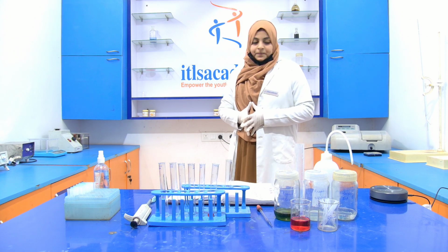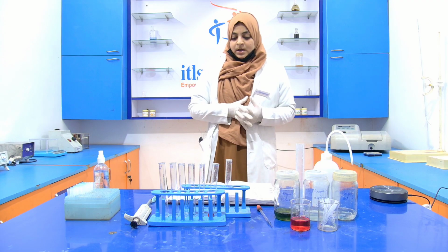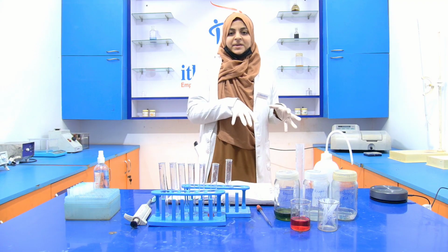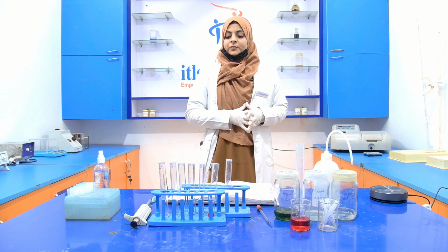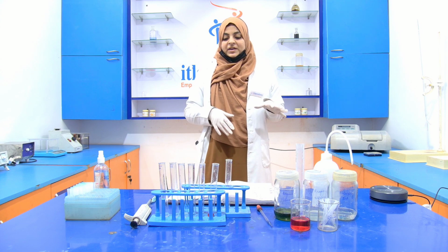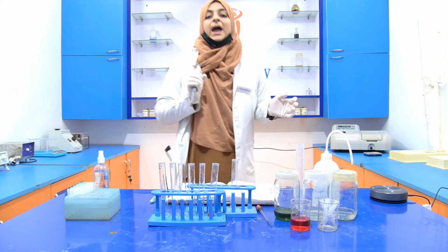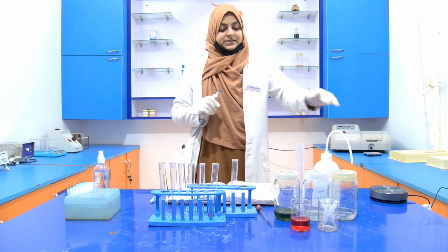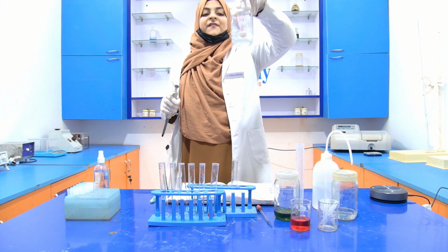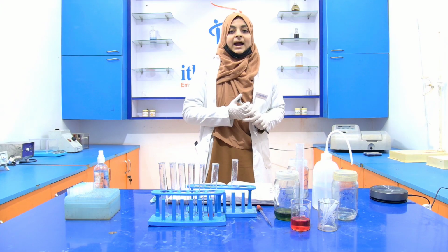Okay. So we are conducting the procedure in which we have already added the different concentrations of BSA and made the volume 1 ml. Now, after making the volume 1 ml in each test tube, we have to add reagent C. This is your reagent C, 5 ml into each test tube, even into the blank.